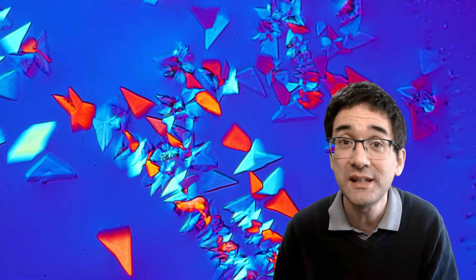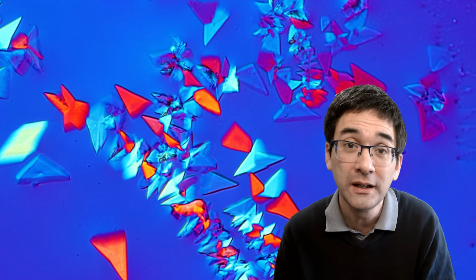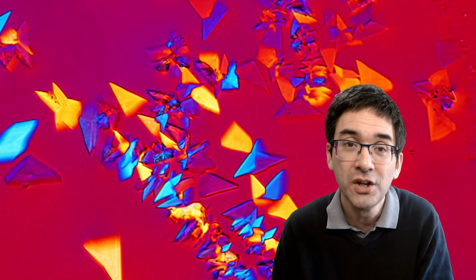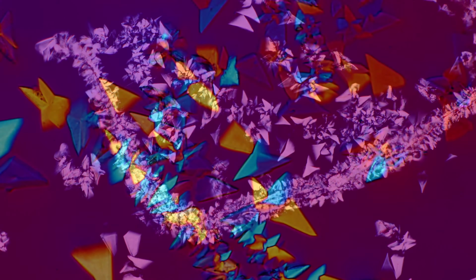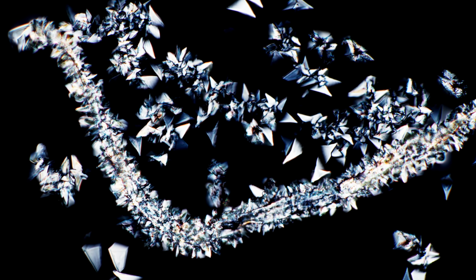And the second reason is because of the fructose and the sugar that is in the Coke. This really likes to attract a lot of moisture from the air. So it does not dry out completely. And I think that could be one of the reasons why crystallization does not happen quite well.